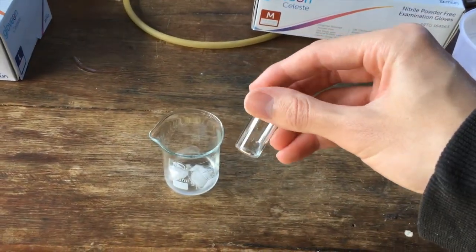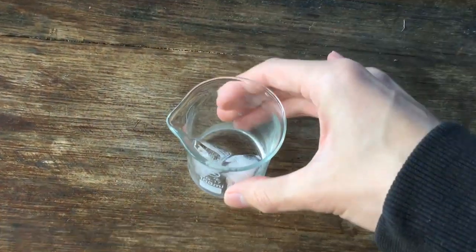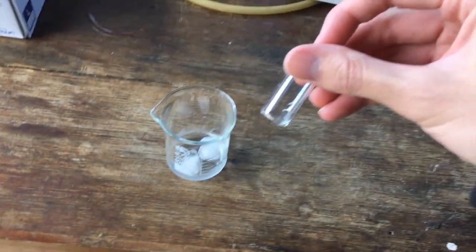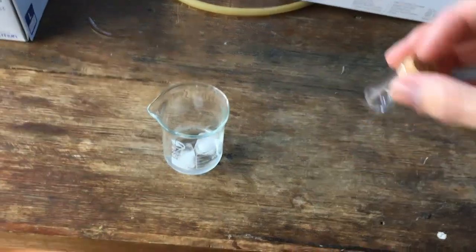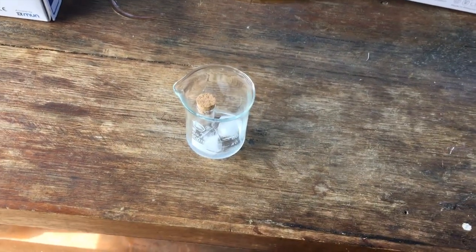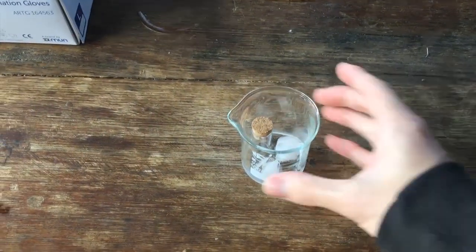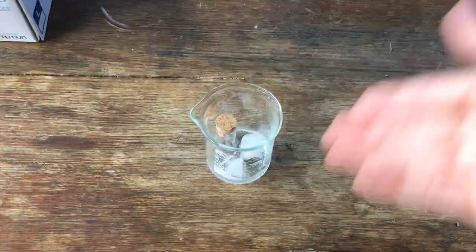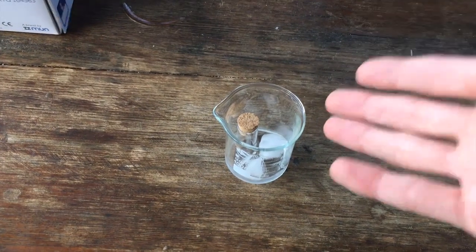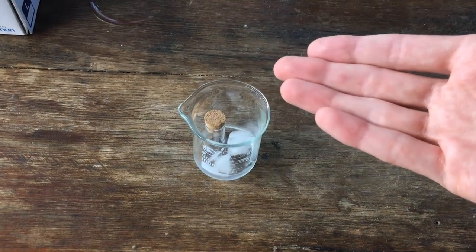So when you stick it in 0 degree water, it freezes solid. And what we should see with our heavy water is, if it is heavy water, when we stick this in 0 degree water, because we've got some ice in the water there, it will solidify, hopefully. So I'll go ahead and just stick that in there and wait a little bit and see if we can get the water to freeze. Obviously, normal water shouldn't do this because, well, if you've got ice that's melting, it shouldn't be able to freeze some liquid water into a solid.